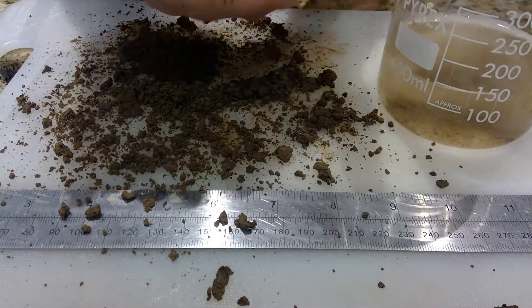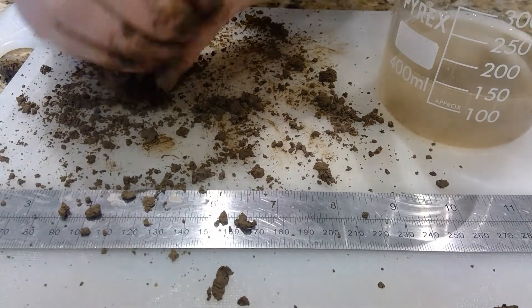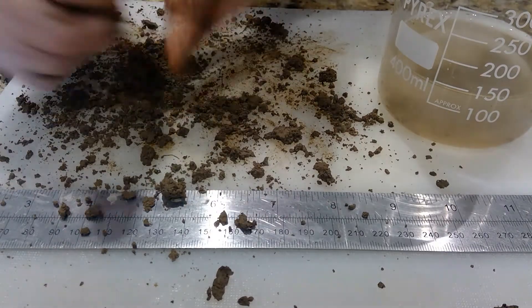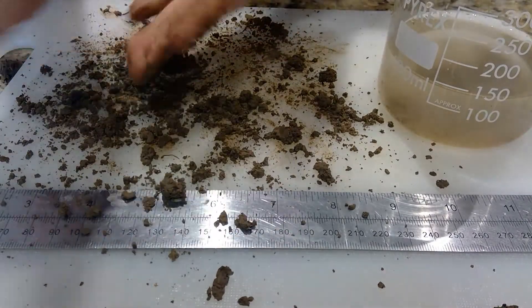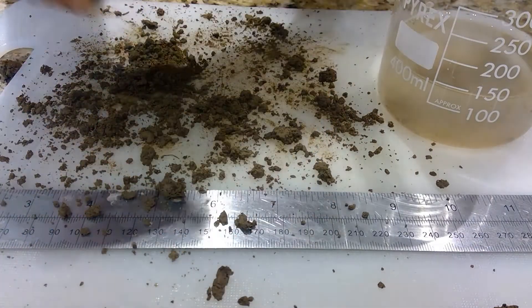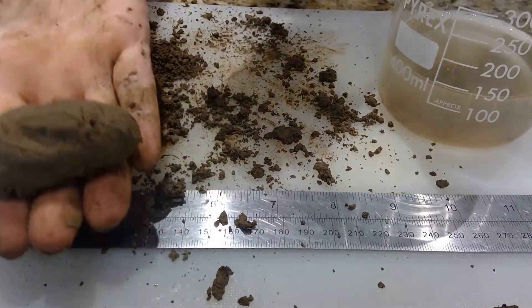If your sample can't be molded it could be an indication that you have a lot of sand in it. But as you can see, this sample has no problems being molded. As you're doing it, constantly feel for stickiness, which can be an indication of clay. And if your hands are stained, that is also an indication that there's silt in the soil.